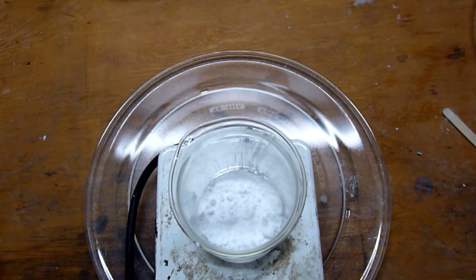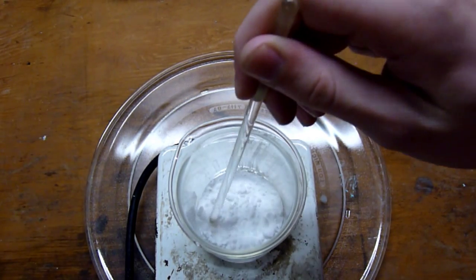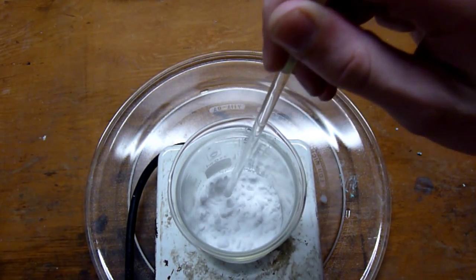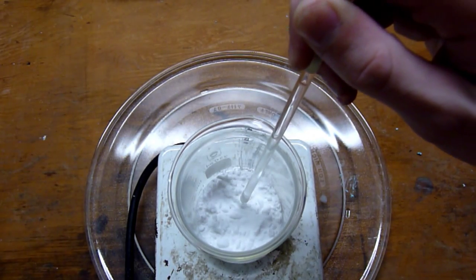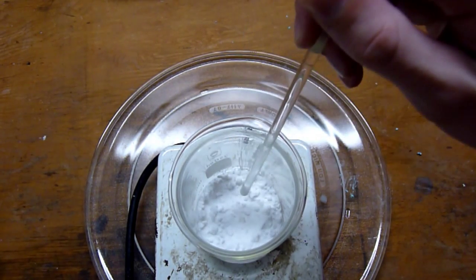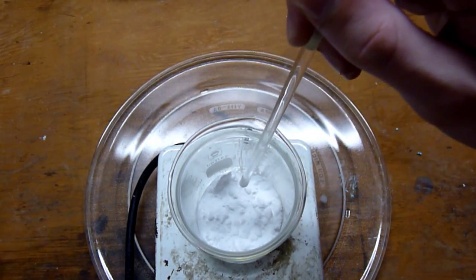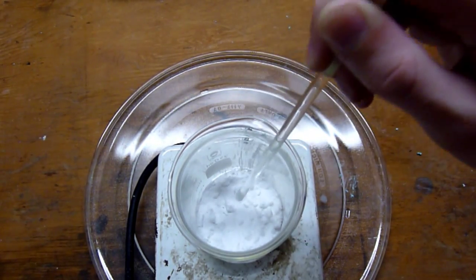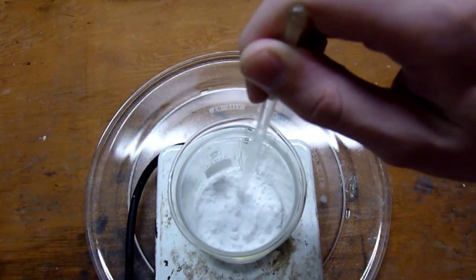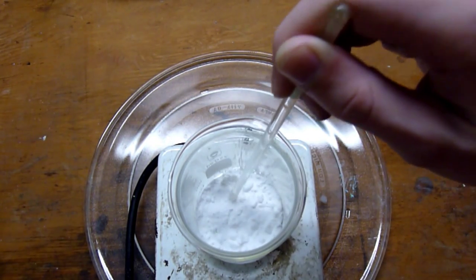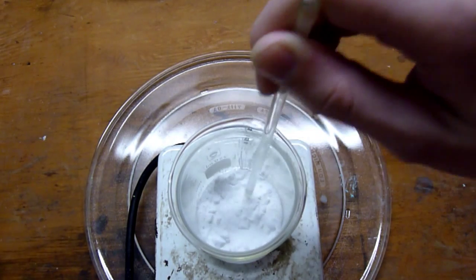Alright, so the sodium hydrogen carbonate has had time to heat up, and now gas evolution has become a lot more apparent. I don't know if it'll still pick it up on camera, but you'll notice when I stir, little blow holes form. See right there at the tip of my stirring rod? There's another one up here a little bit. Oh, see right there? It becomes very fluffy.